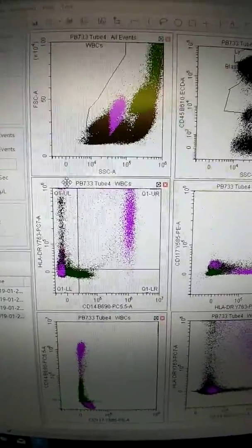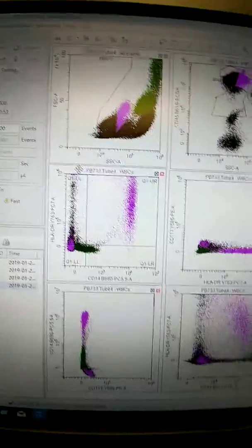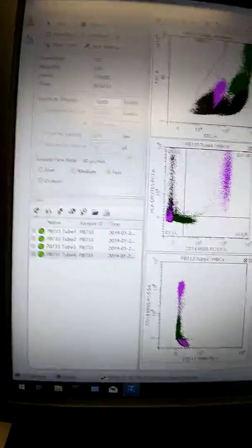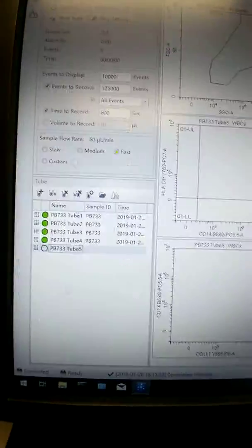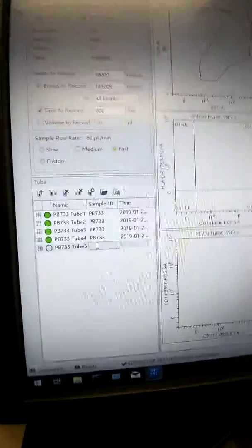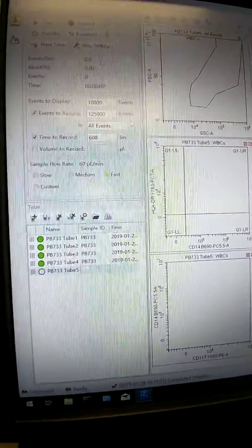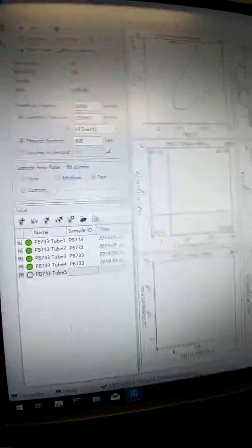So I know he wanted the PC7 brought down. I think maybe the PC5 as well. So what we can do is I'm going to come here and we'll click on this plus tube. That way it copies that same tube with the same acquisition settings. And we're going to say, let's see, let's wait to name it first.